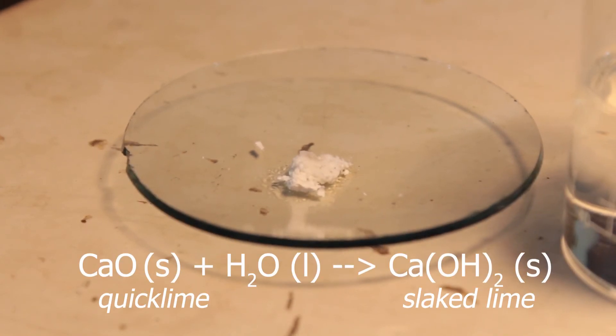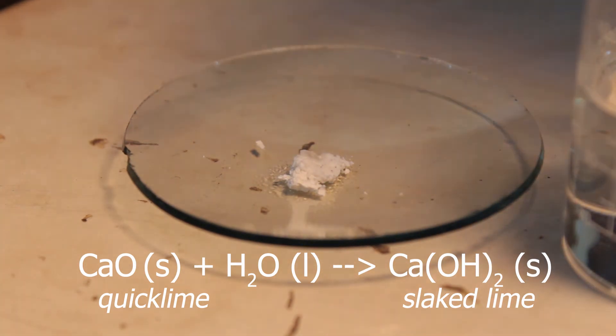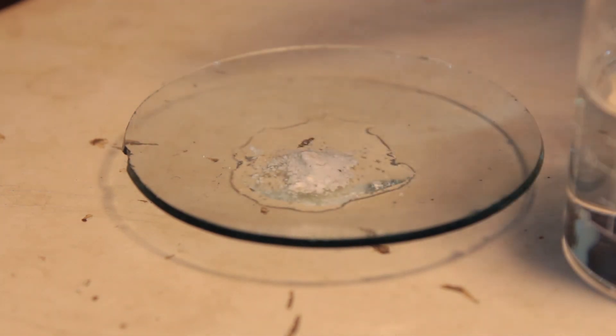Calcium oxide reacting with water, making calcium hydroxide, this fluffy white solid. You know that marble is totally not soluble in water, otherwise we would never have marble palaces surviving to our days. It's not soluble.